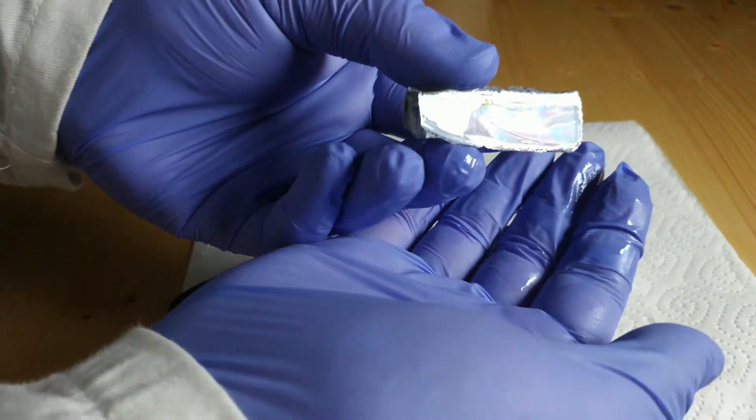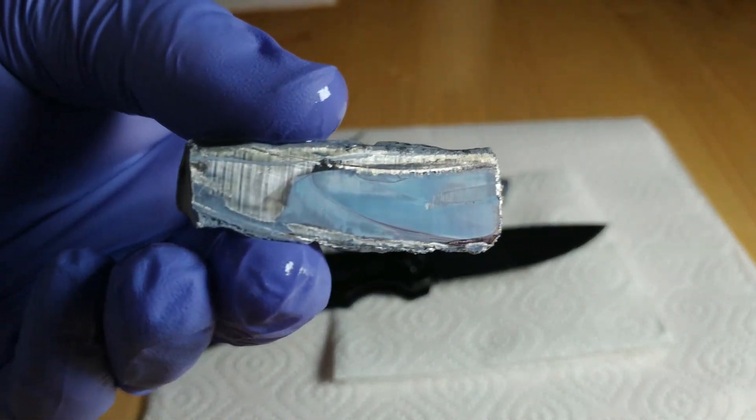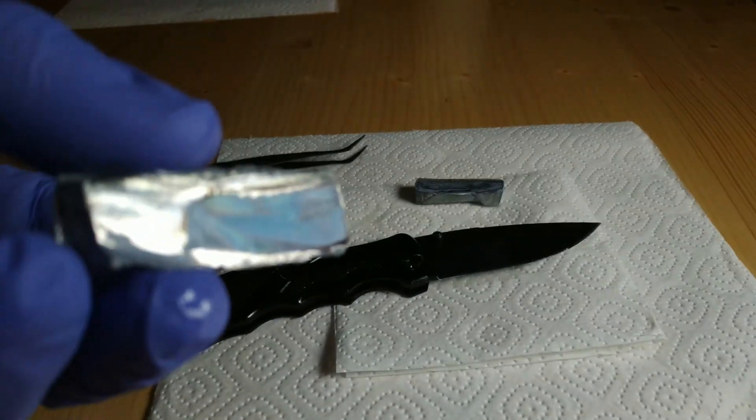As you can see, the surface remains shiny only for a very short time and tarnishes quickly.